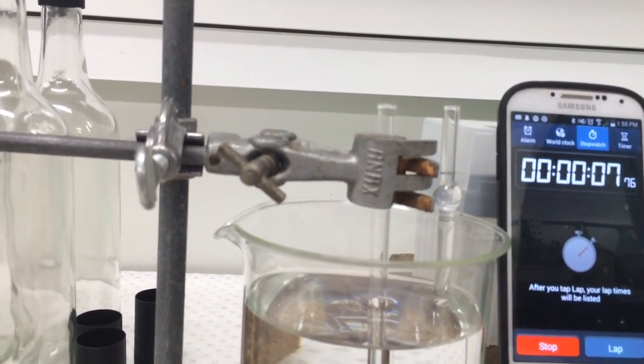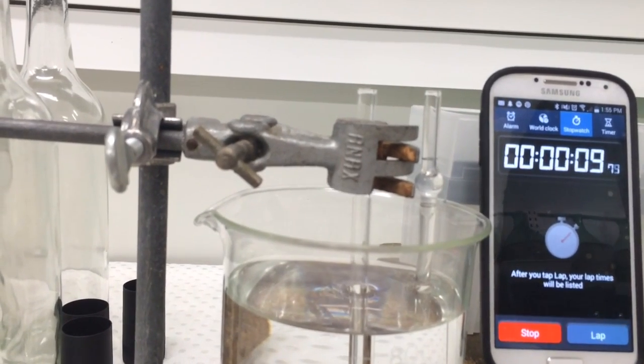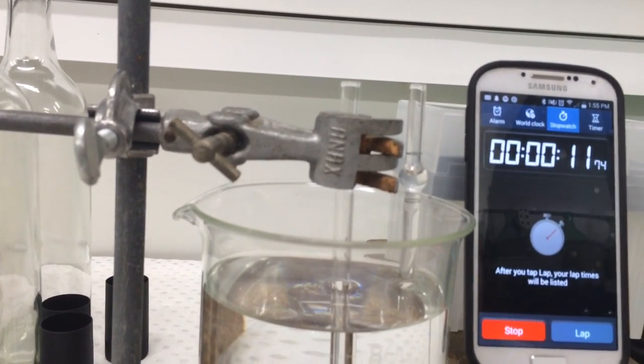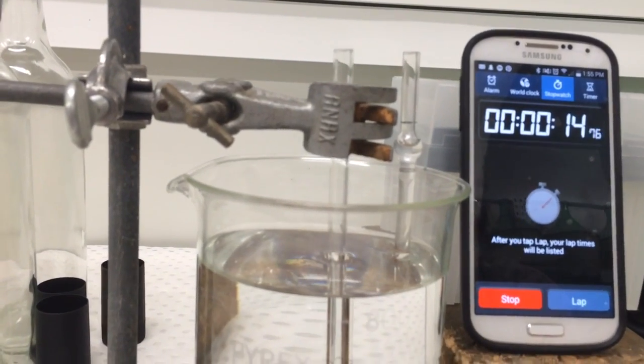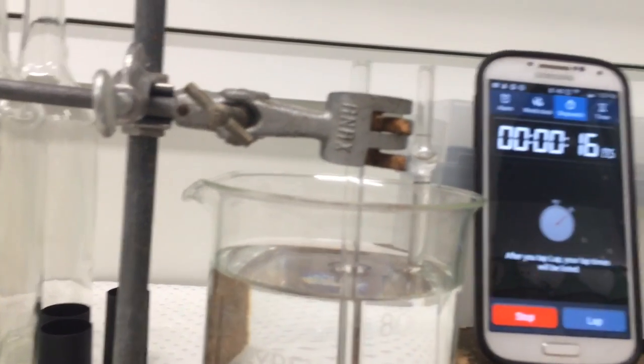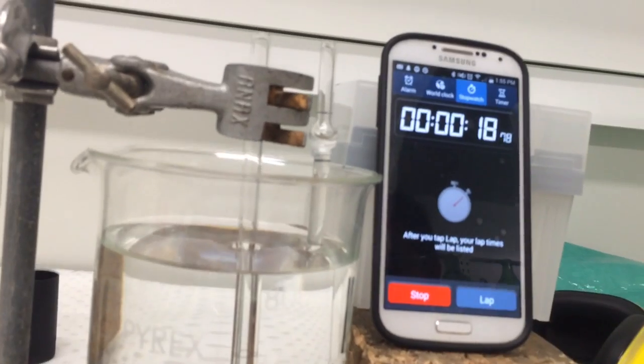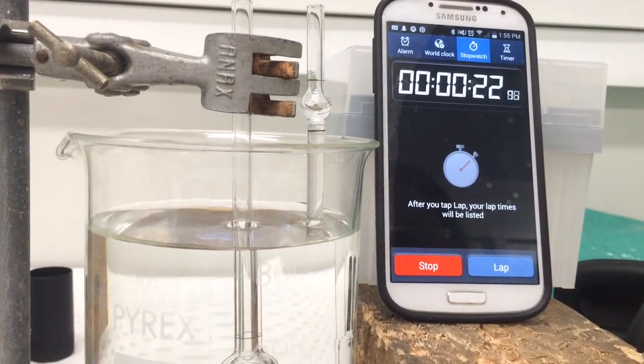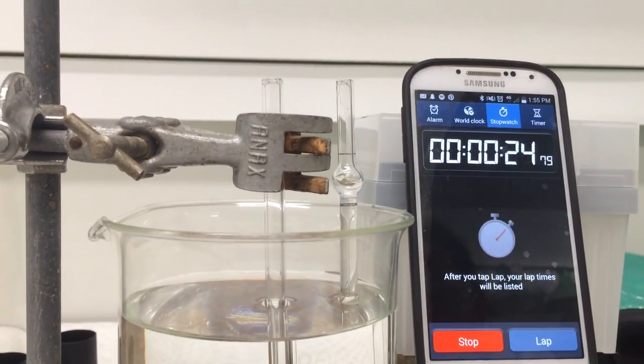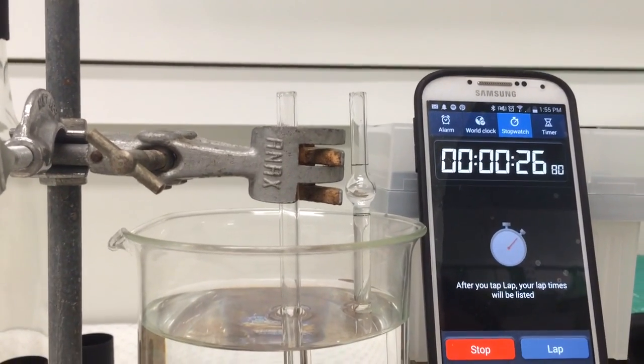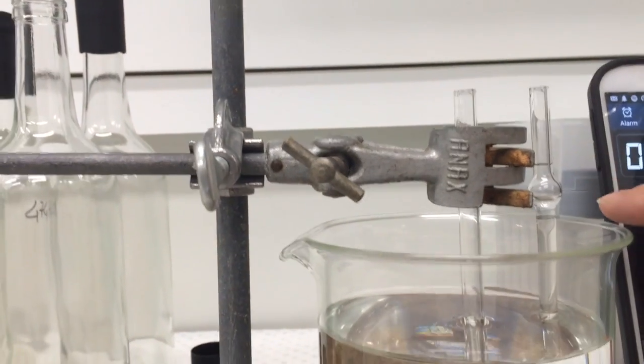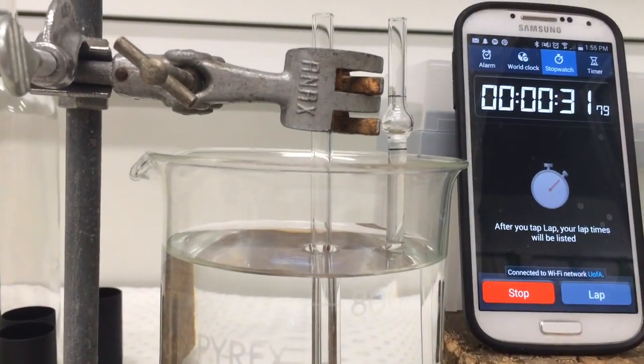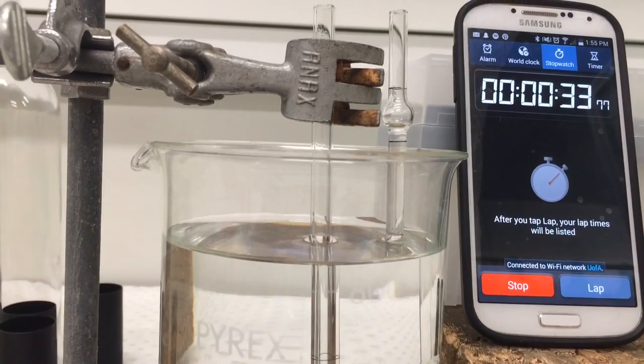So that's why you've got the movies and you can see where you got the water there and the time there. We try to get the movie of that. Focus then, and at first you may leave the camera above a little bit so you can see that line flat, and then later you lower it down a little bit to see that line flat.